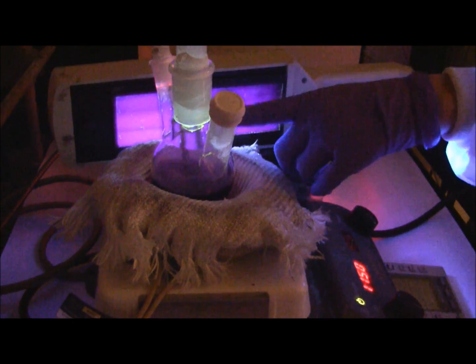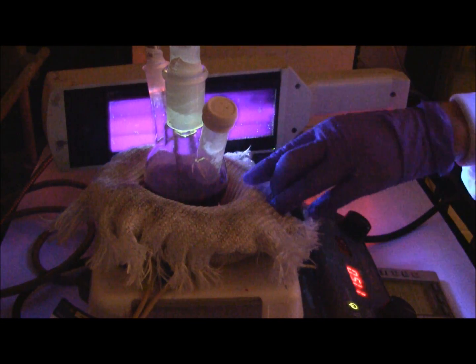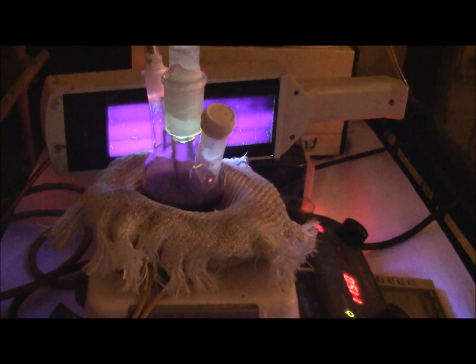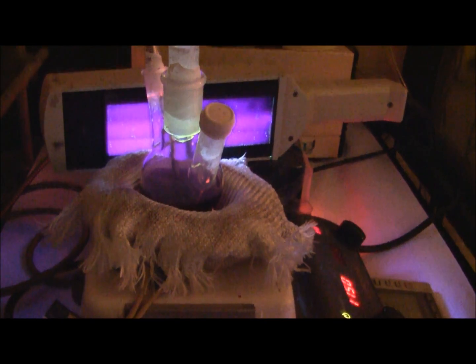You can see they're starting to turn orange. Down in the pot where everything's more uniformly warm, they're all red but so hot that you can't see it glowing.